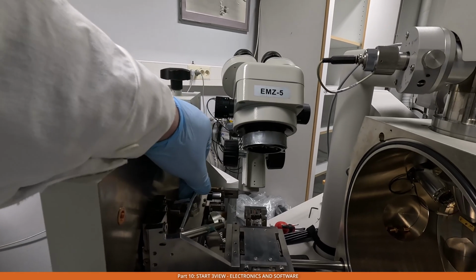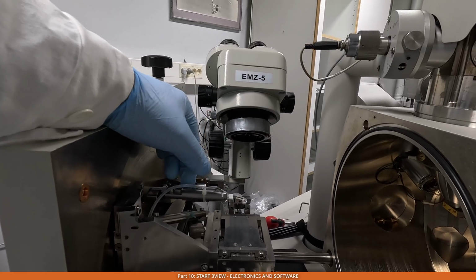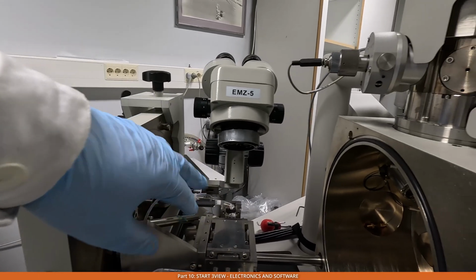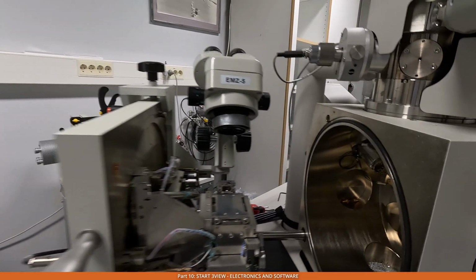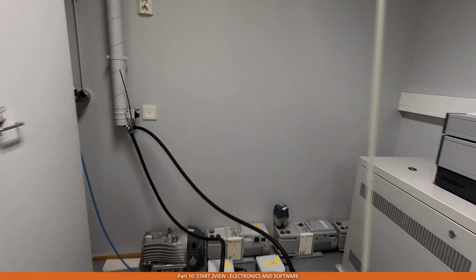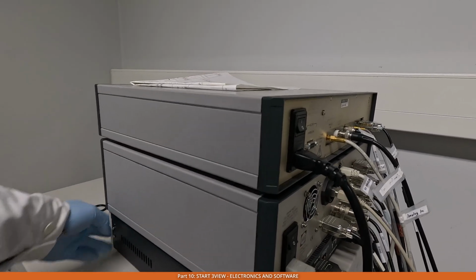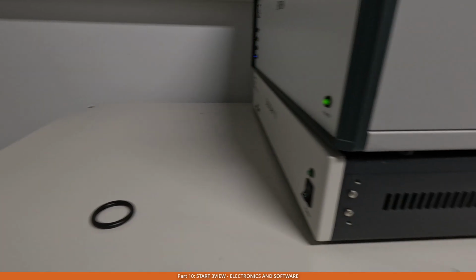The next thing here on the door is the LED that will be used to put the light over the sample. Now it's off because we have not switched the boxes yet for the 3-view. So we connected the cables. Now we go to the boxes here, and then we switch them on. And the third box has the switch on the front side here.